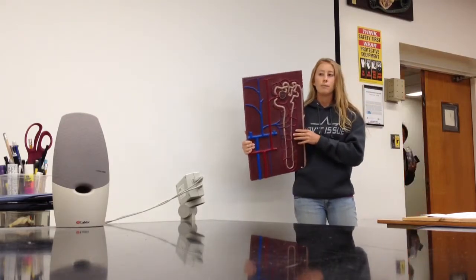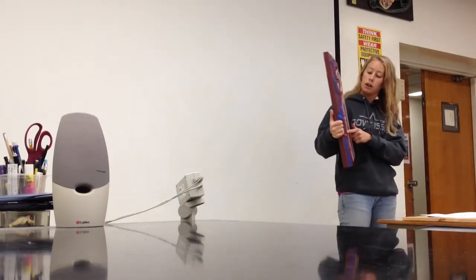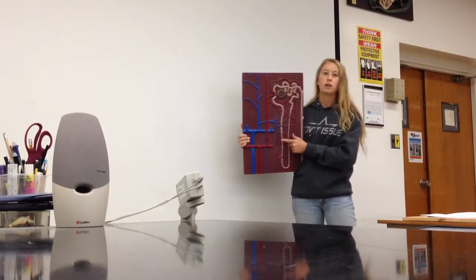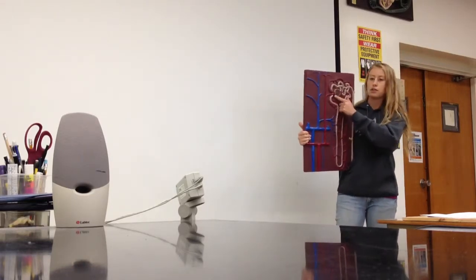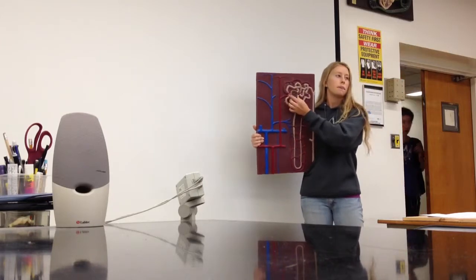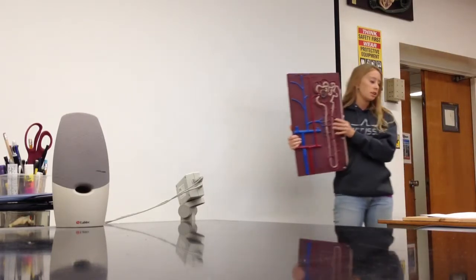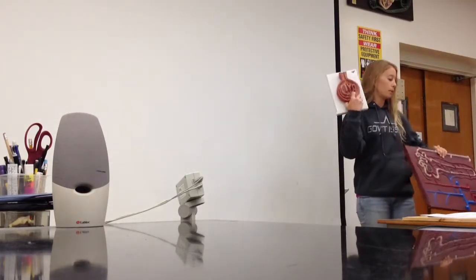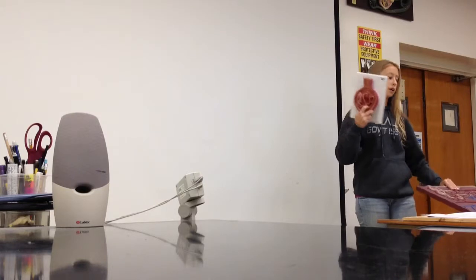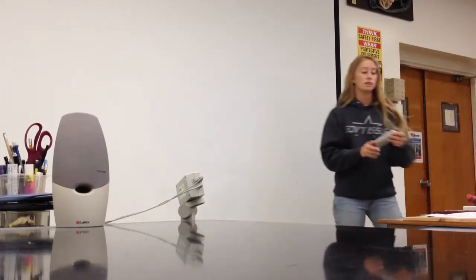Just looking at this, you can see the tubes that are this pinkish tan color. Those are the nephron tubules, and this structure here, the circle structure, is the renal corpuscle. I'll talk about the structures in that in a second. This model is just a model of the renal corpuscle. Make sure that you can identify the parts on these two as well as on the slides.